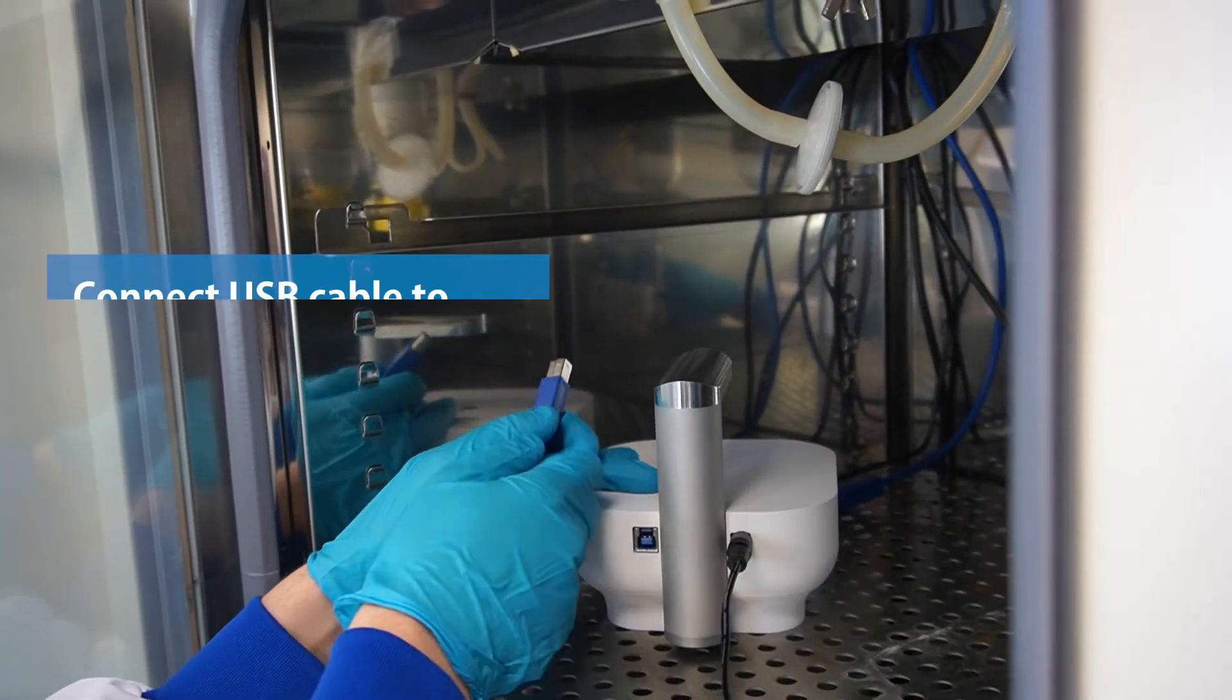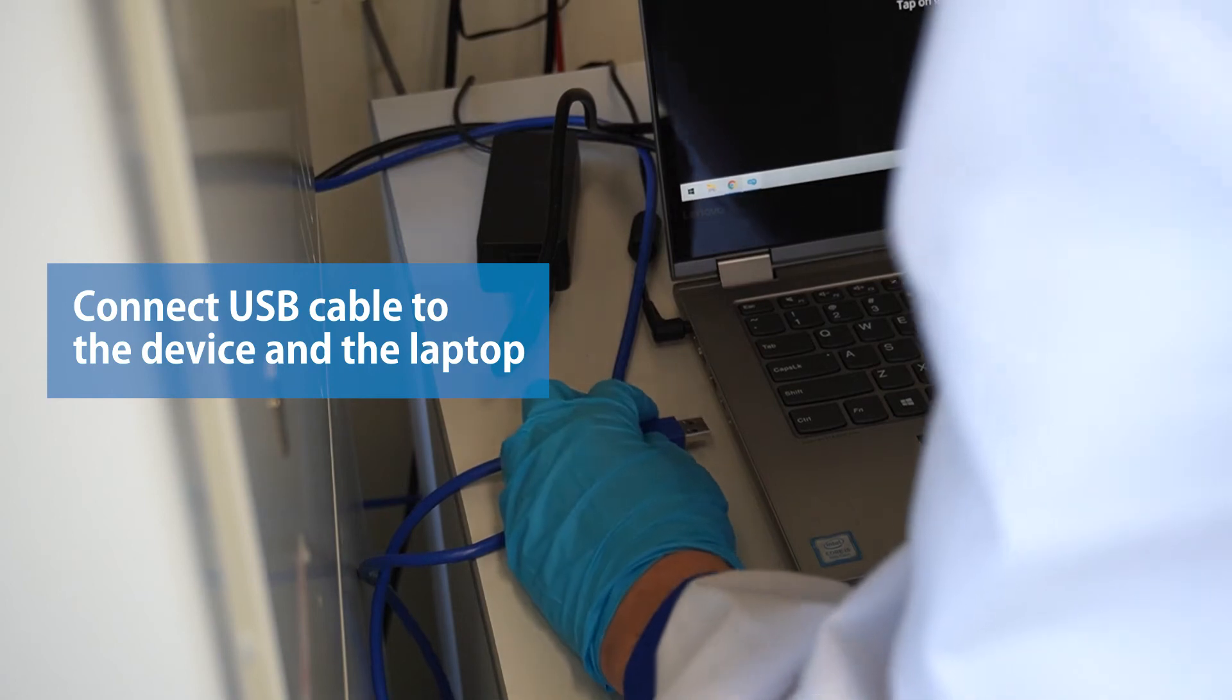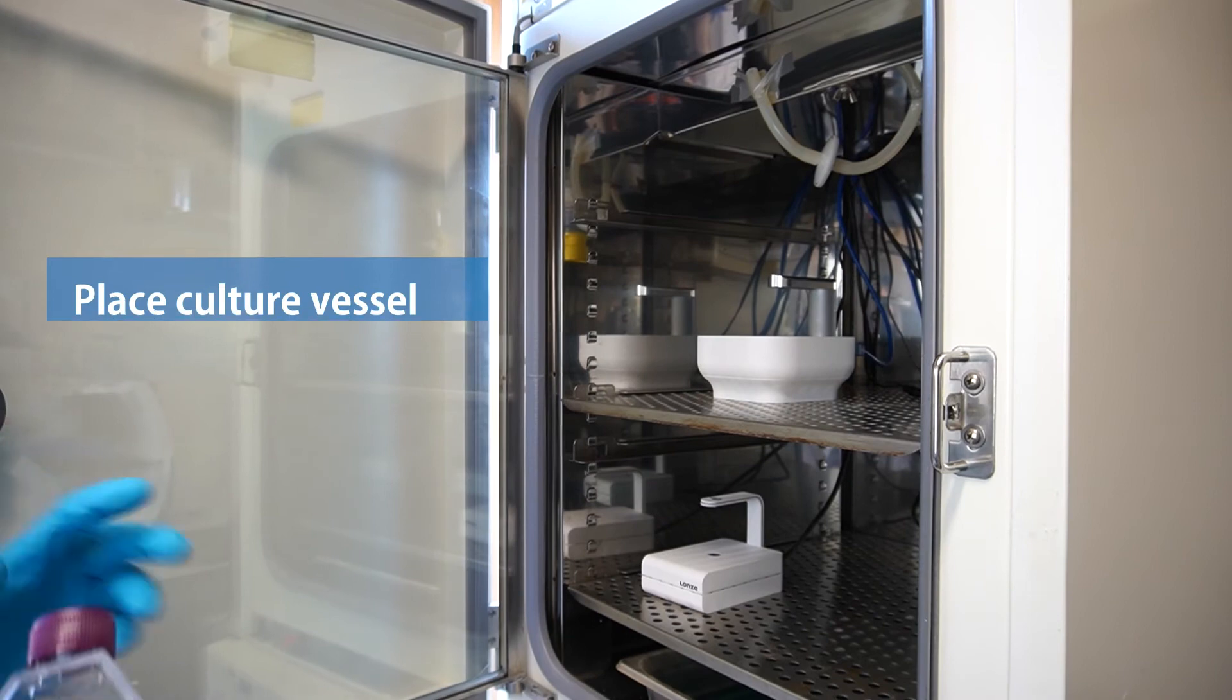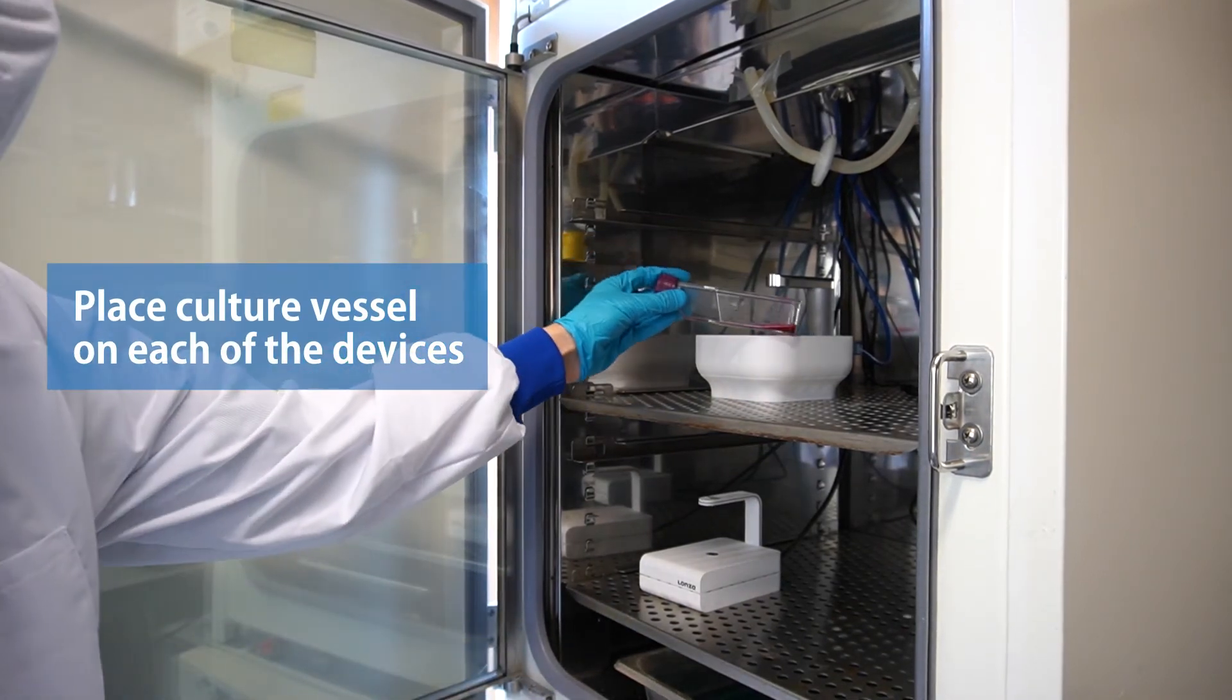Connect the adapter to the power supply and afterwards connect all devices to the same laptop with a USB cable. Place a culture vessel with fluorescently labeled cells on each of the devices.